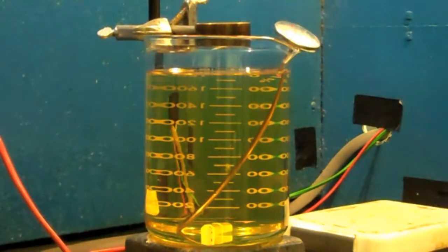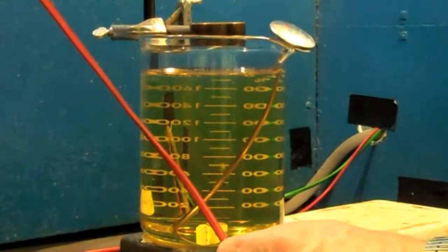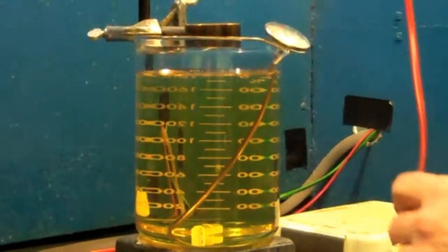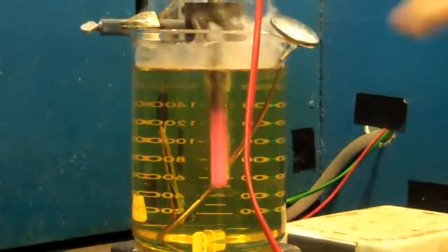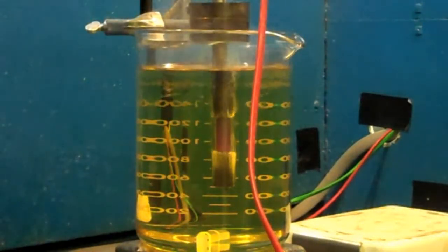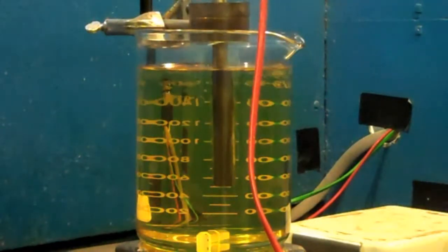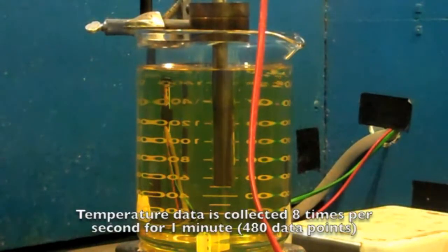It's a static test. We then, on our computer, hit the run test button to start acquiring data. Then transfer the probe as quickly as possible into the quenchant. As soon as the probe is placed into the quenchant, we start collecting data.